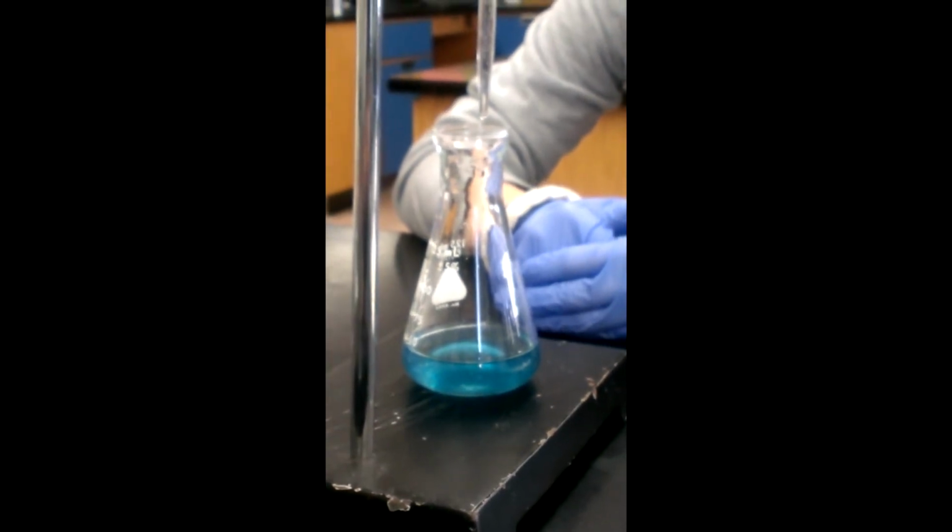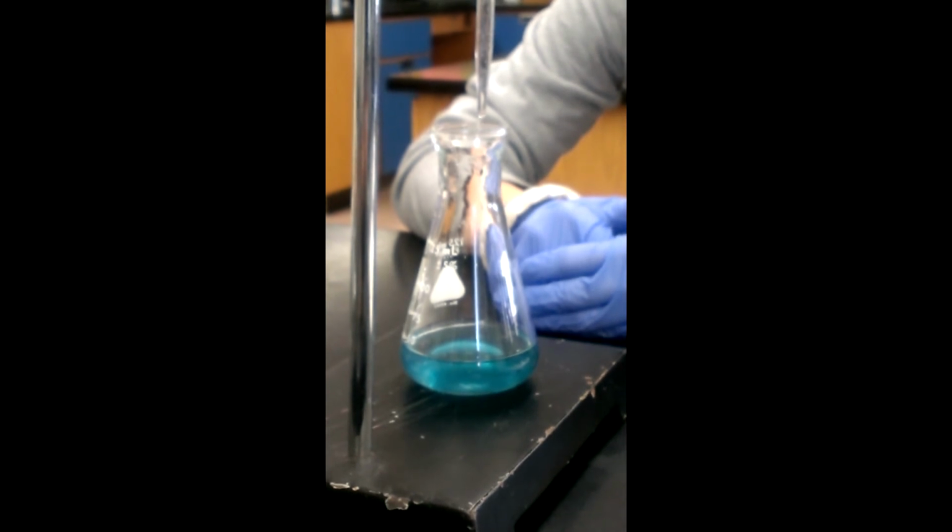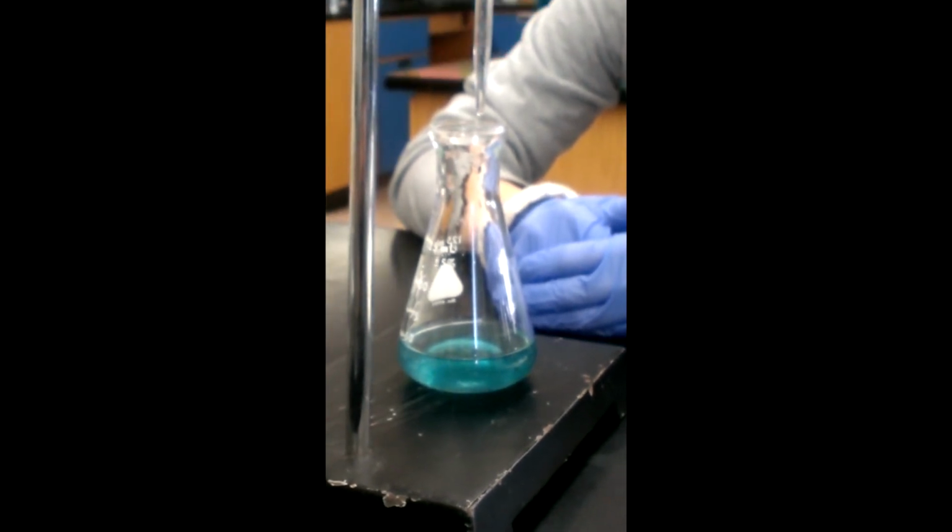So the student adds a little bit more of the titrant into the analyte, and when they do this, you notice some blue color occurring. It goes really quite blue. If you were with a strong acid, you would certainly stop here and take your reading. But with a weak acid, you may have to wait a little bit longer because, as you see, you can see the yellow color starting to be produced once again.